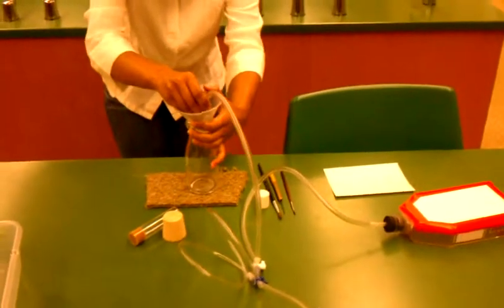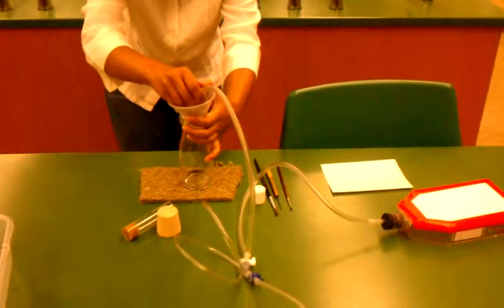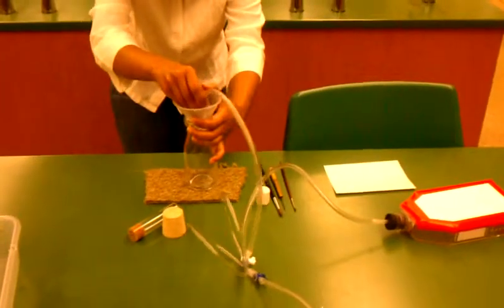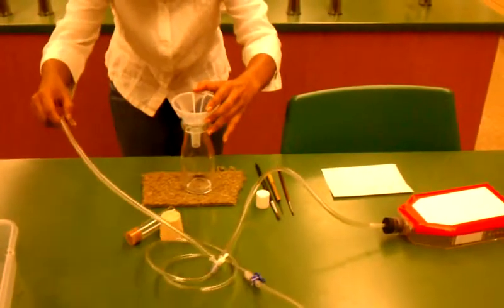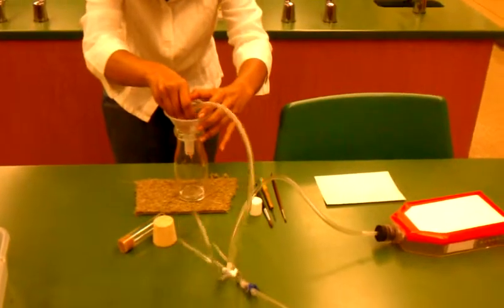You'll see the carbon dioxide entering the bottle because the flies will become knocked out, and you want them completely immobile on the bottom of the bottle.